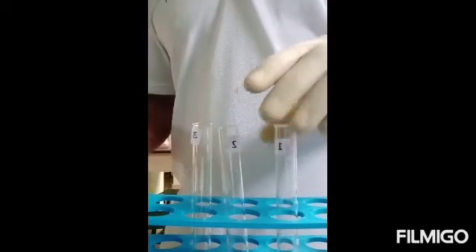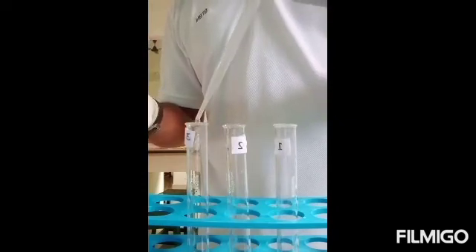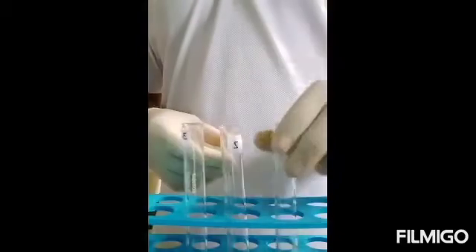Now we add two to three drops of one percent ninhydrin to each of these test tubes — just two or three drops only. Don't forget to shake the tubes well after addition of the reagent. These tubes are then taken to a boiling water bath.